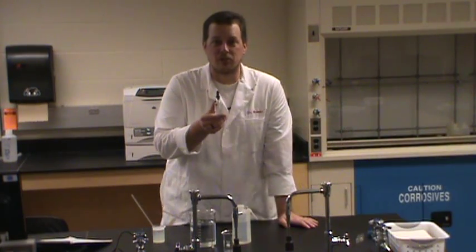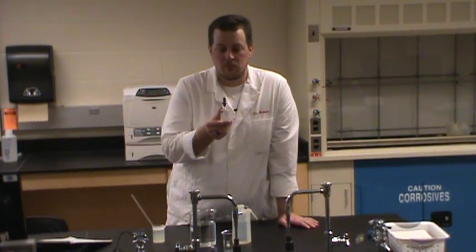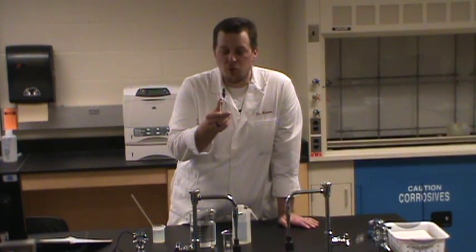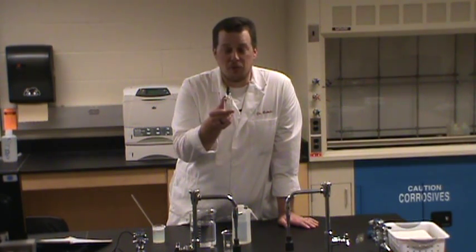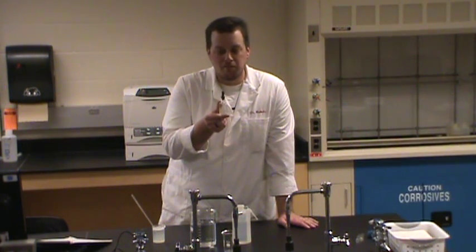I want you to think about what you would call this reagent. How would you describe its visual appearance? Do you have an idea in your head? What did you call it? How many of you called this colorless? How many of you called it white? That's two ways to describe this solution, and depending on what you're trying to describe, neither one may be correct.